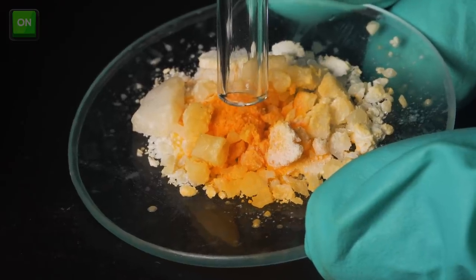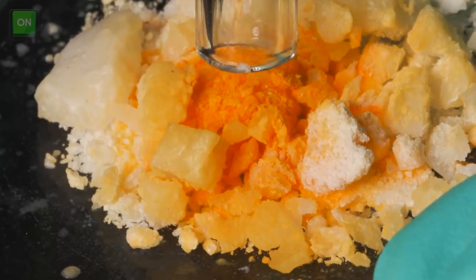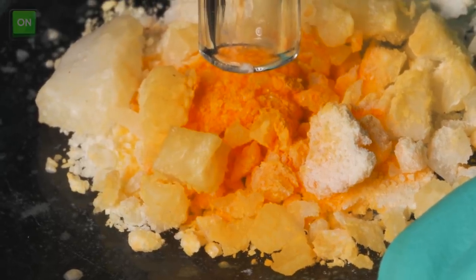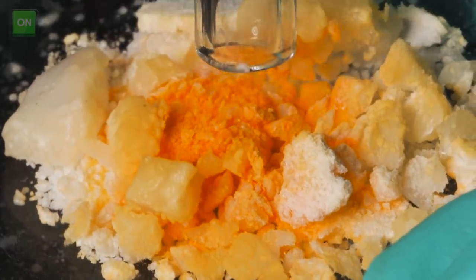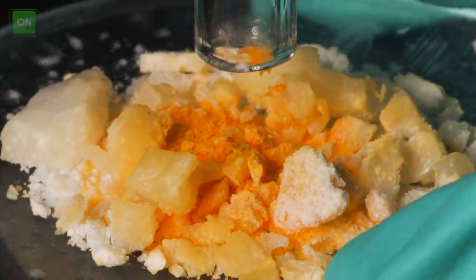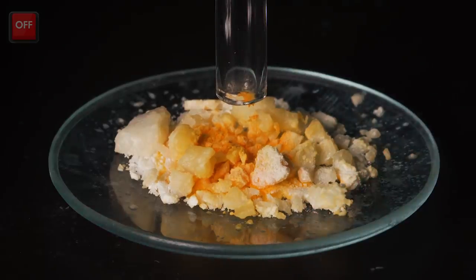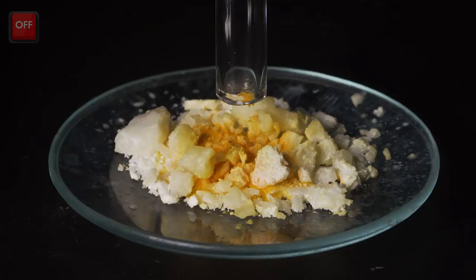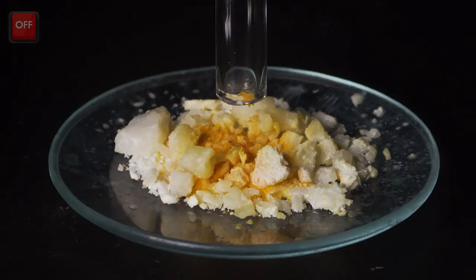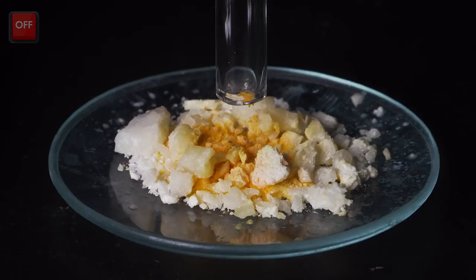Now I'll turn off the supply of ozone and the potassium ozonide will decompose quickly due to humidity and not low enough temperature. Potassium ozonide is quite an unstable compound and sometimes it decomposes with an explosion.